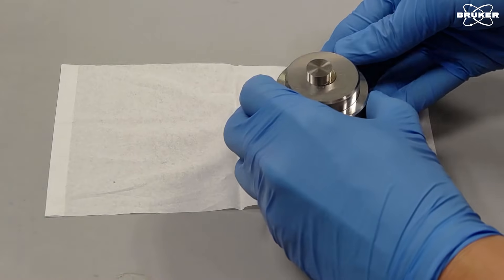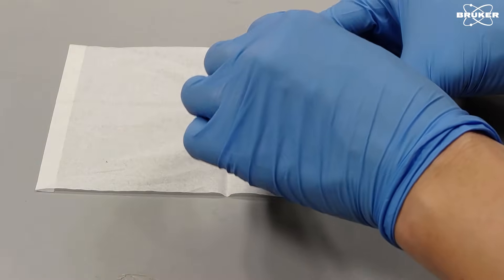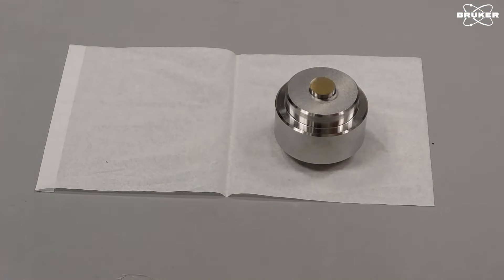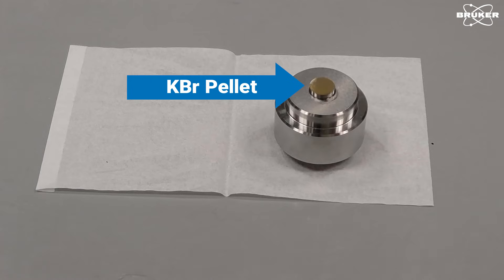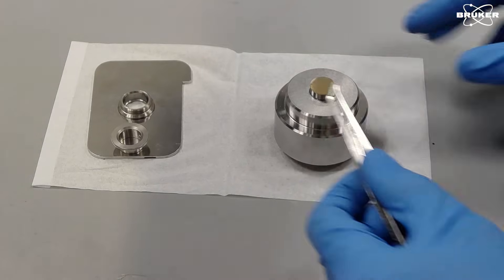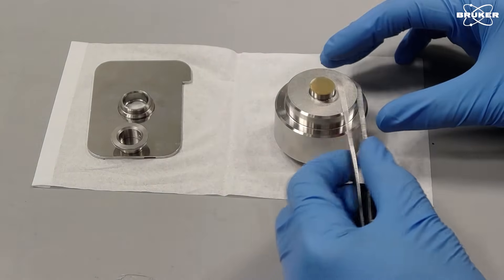Now we can carefully take out the KBR pellet. Lastly we transfer the KBR pellet to a pellet holder.